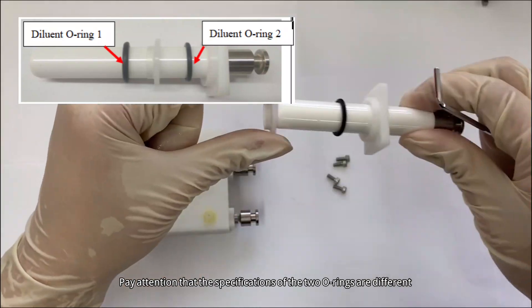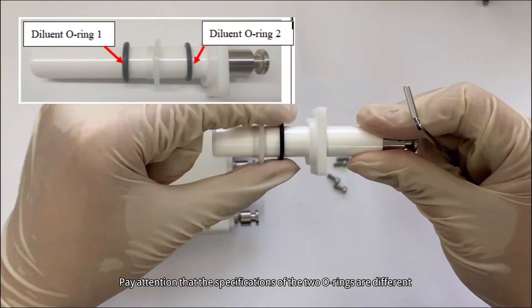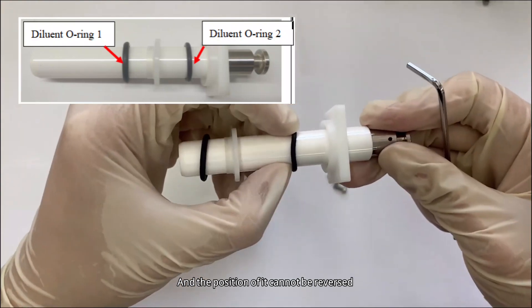Pay attention that the specifications of the two O-rings are different, and the position of them cannot be reversed.